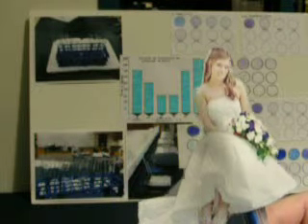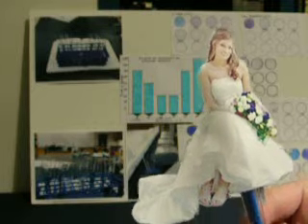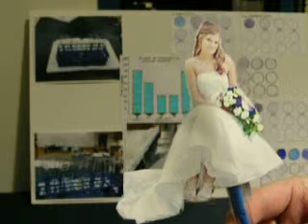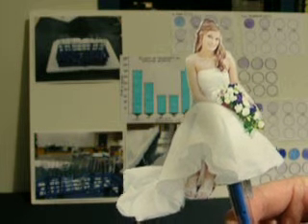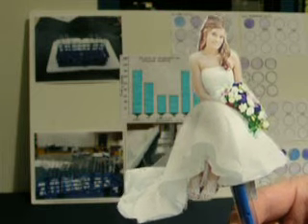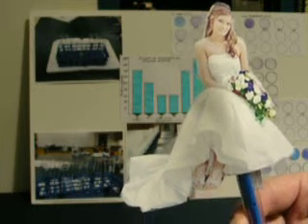For our experiment, we placed 1 milliliter of starch and 0.25 milliliters of amylase in 6 separate test tubes. We placed a set of test tubes, 1 amylase and 1 starch, in warming tubs at temperatures of 20 degrees Celsius, 40 degrees Celsius, 60 degrees Celsius, and 80 degrees Celsius.